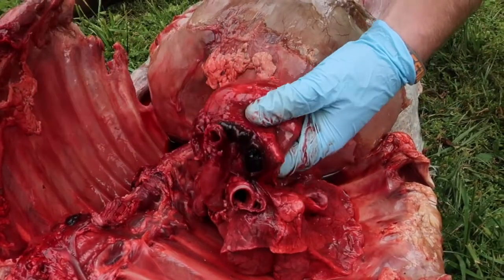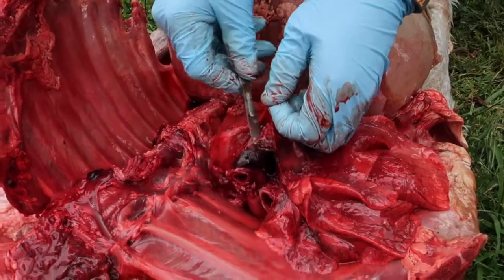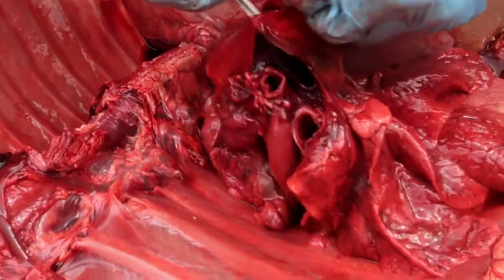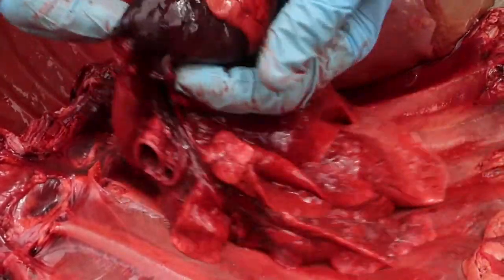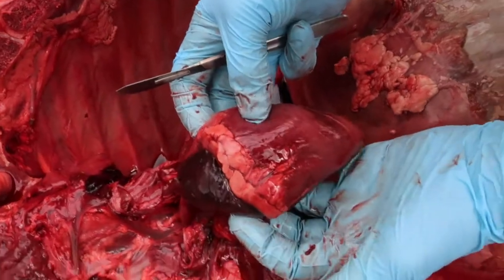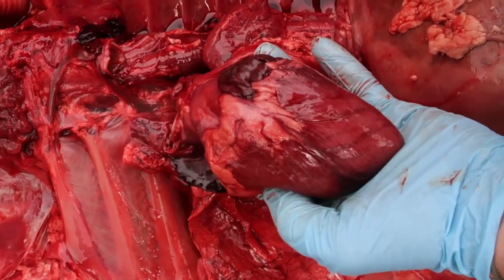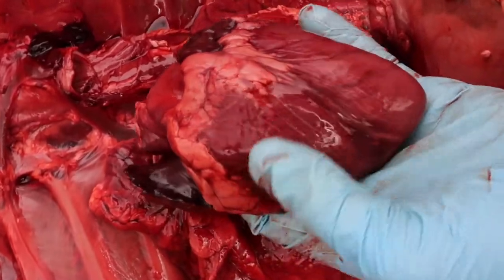And so what I'm going to do is I'm going to see that the heart is in this pericardial sac here, and I'm just going to kind of open this up so we can take a closer look at the heart. Okay, you can see the heart is a very strong muscular organ that's able to pump blood either to pulmonary circulation, so to the lungs, or to systemic circulation to the body, sending oxygenated blood to the body, so to supply the different tissues with oxygen.